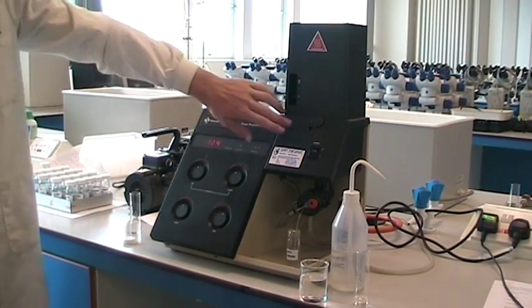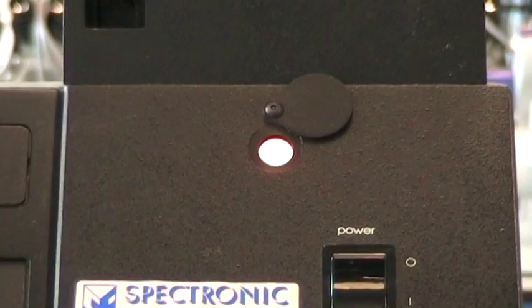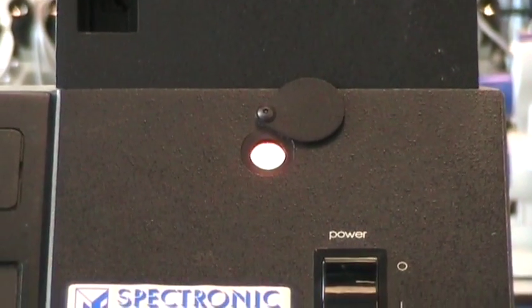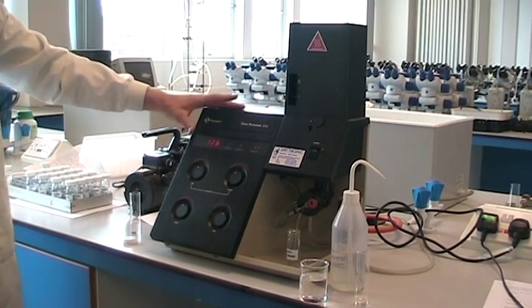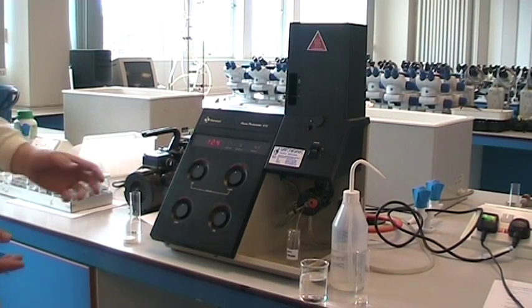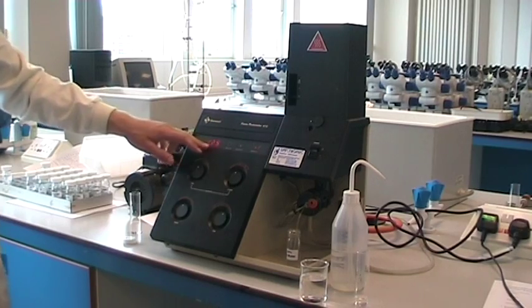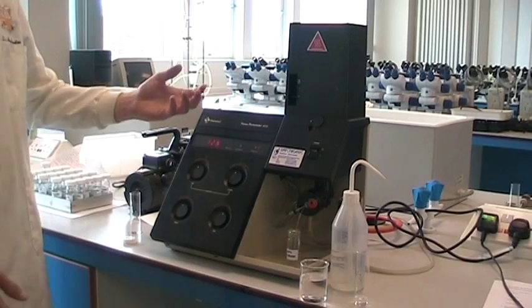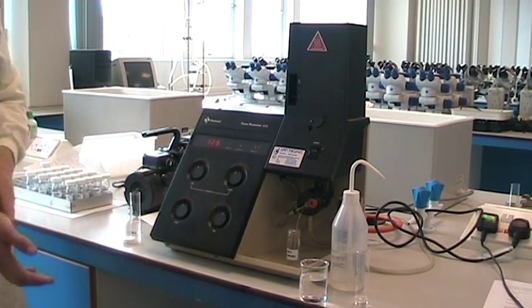You can see that the flame is orange because the sodium ion is going through it. The sodium ions emit luminescence, and the photoelectric cell accepts this light and converts it into millivolts, which is why you get your reading in millivolts. Health and safety: do not put your hand above the chimney — it is quite hot.